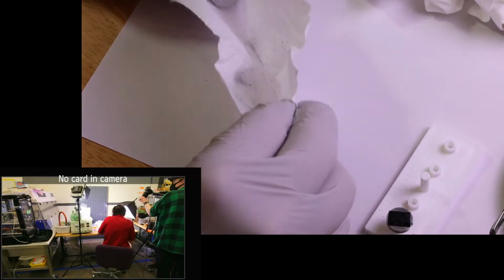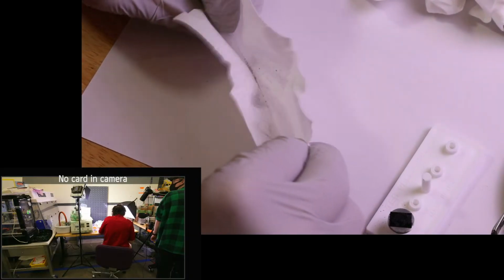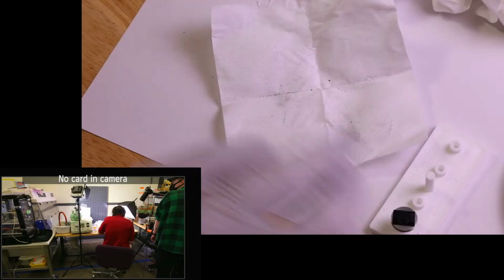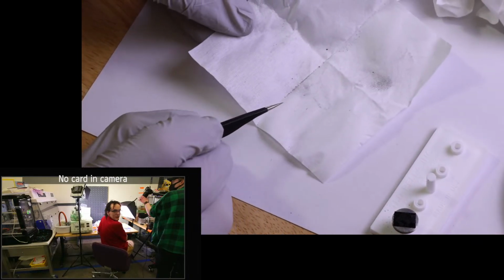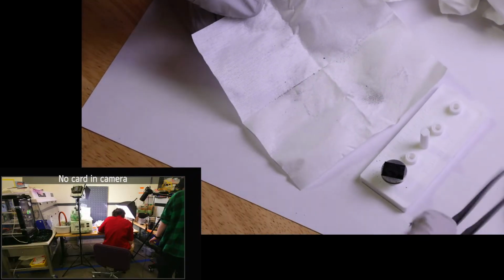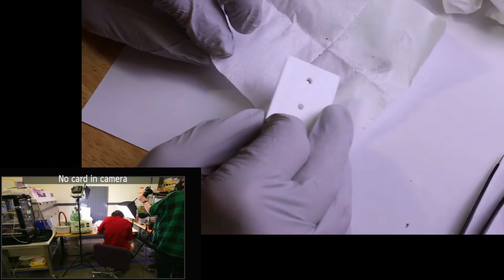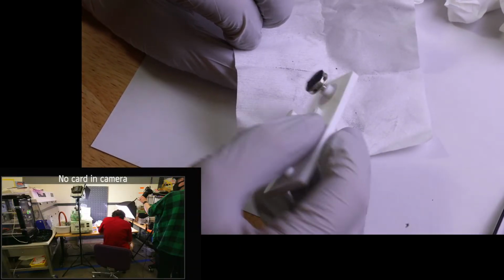We'll just kind of tap this a few times so they all kind of go into that V. Okay, we got a nice set of all of our stuff that we're trying to target tonight. So I think it shows up on camera probably, that all that debris, that line right there. And before we start messing around, I'm going to just move a few pieces over manually, I think. Actually, we'll just try it. We'll see if we can just kind of gently stick it to stuff. Oh, that did a great job.